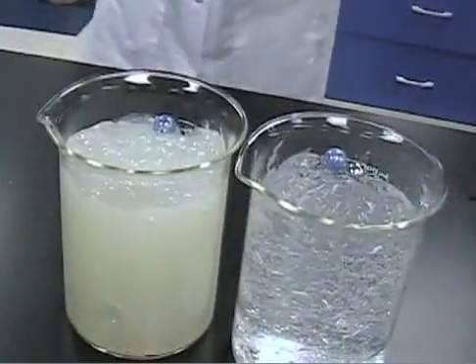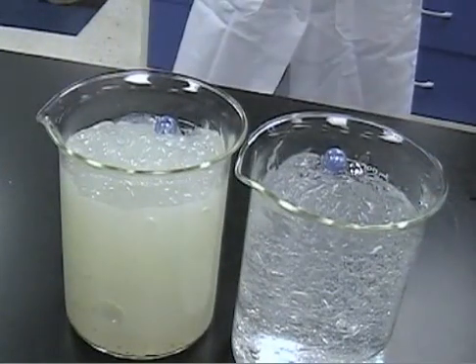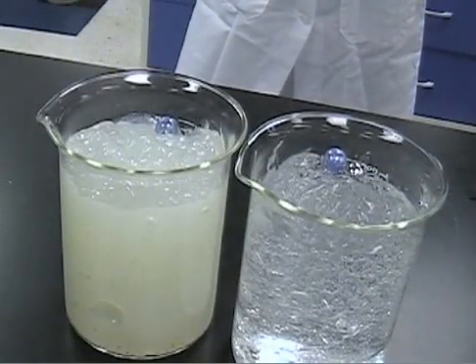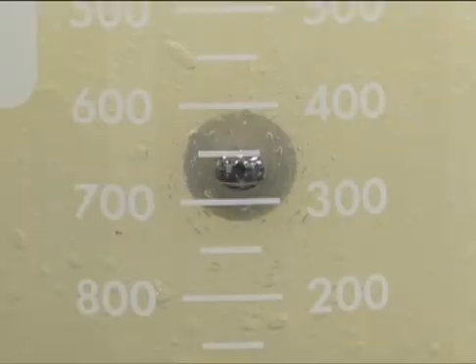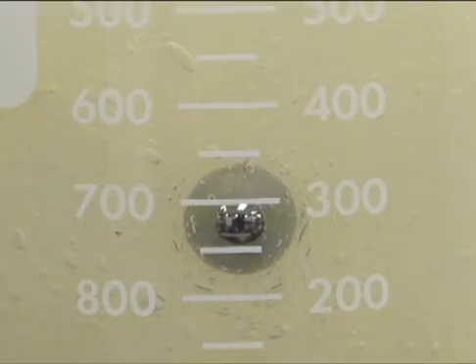The xanthan gum gel is able to suspend the glass marble. However, it offers little or no resistance to the force of gravity as the dense sphere drops to the bottom of the beaker and the light sphere slowly rises to the top.